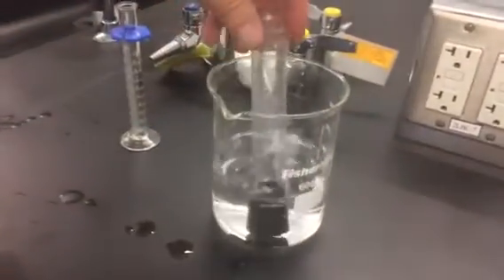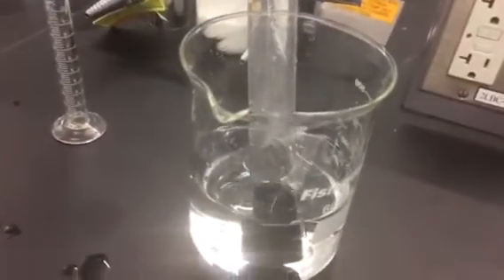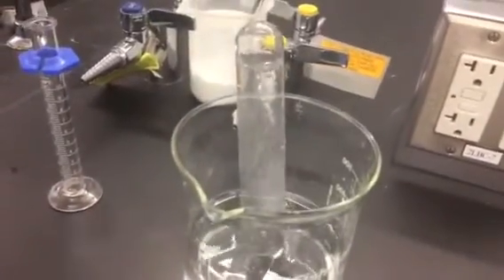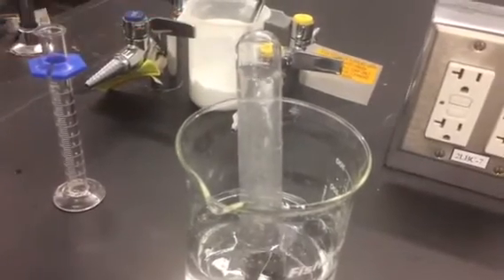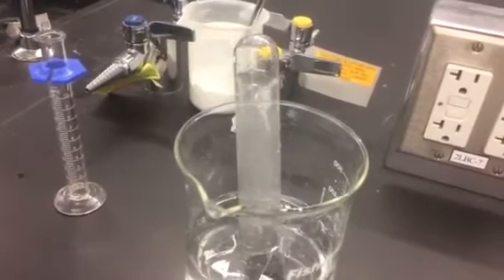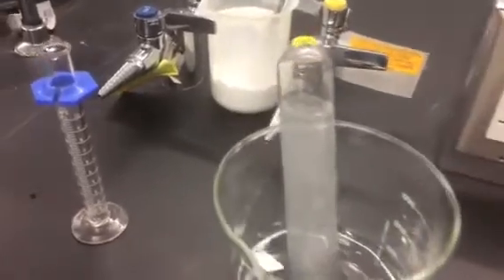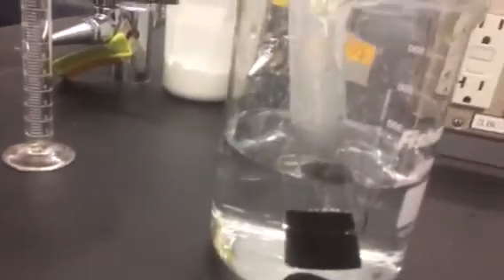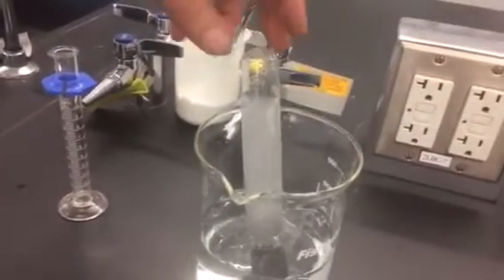And so we can see there that the acid has traveled down to the magnesium ribbon and is producing that single replacement reaction where we're making soluble magnesium chloride and hydrogen gas. You can see the hydrogen gas collecting in the top of the test tube because the acid is concentrated and hydrochloric acid is a strong acid. The reaction runs quite quickly and in a quite short period of time. The entire reaction will be done.